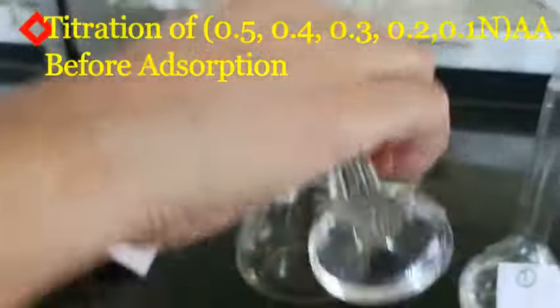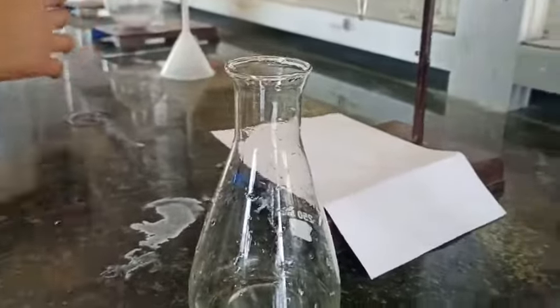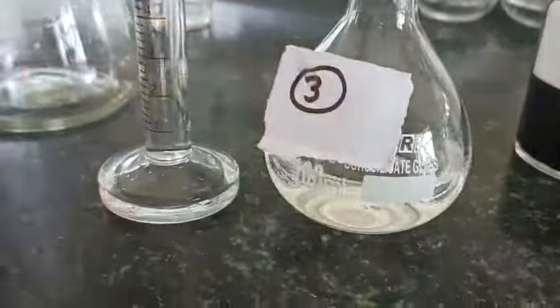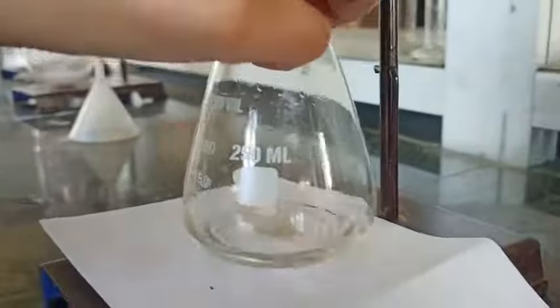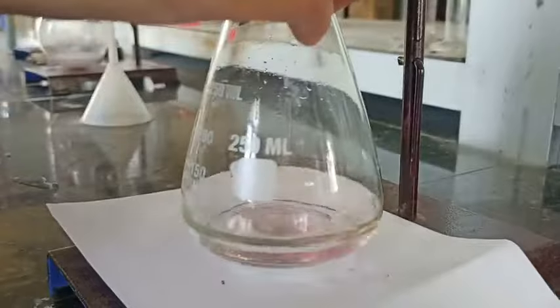The next step is to titrate the acetic acid solutions before adsorption. I have taken 10 ml of 0.5 normal acetic acid and I am going to titrate it against 0.5 normal NaOH solution, which I standardized previously. If you want to know the standardization of NaOH, you can check the previous video. Here is the final reading for solution 1, that is 0.5 normal.